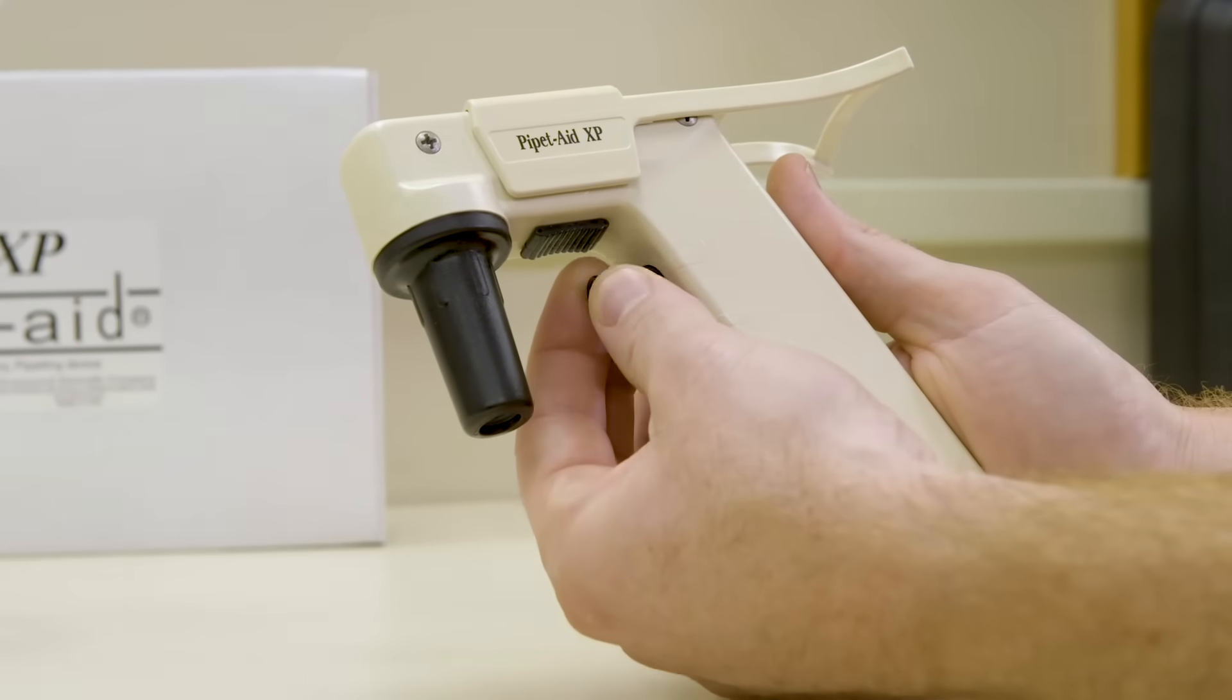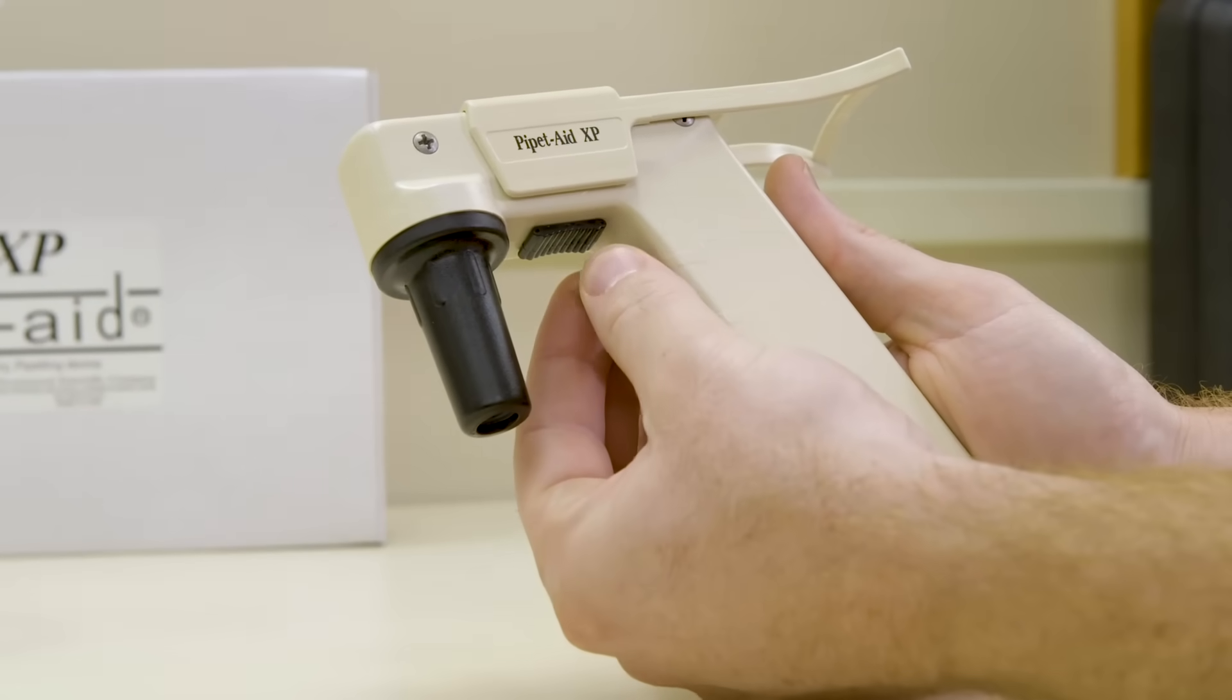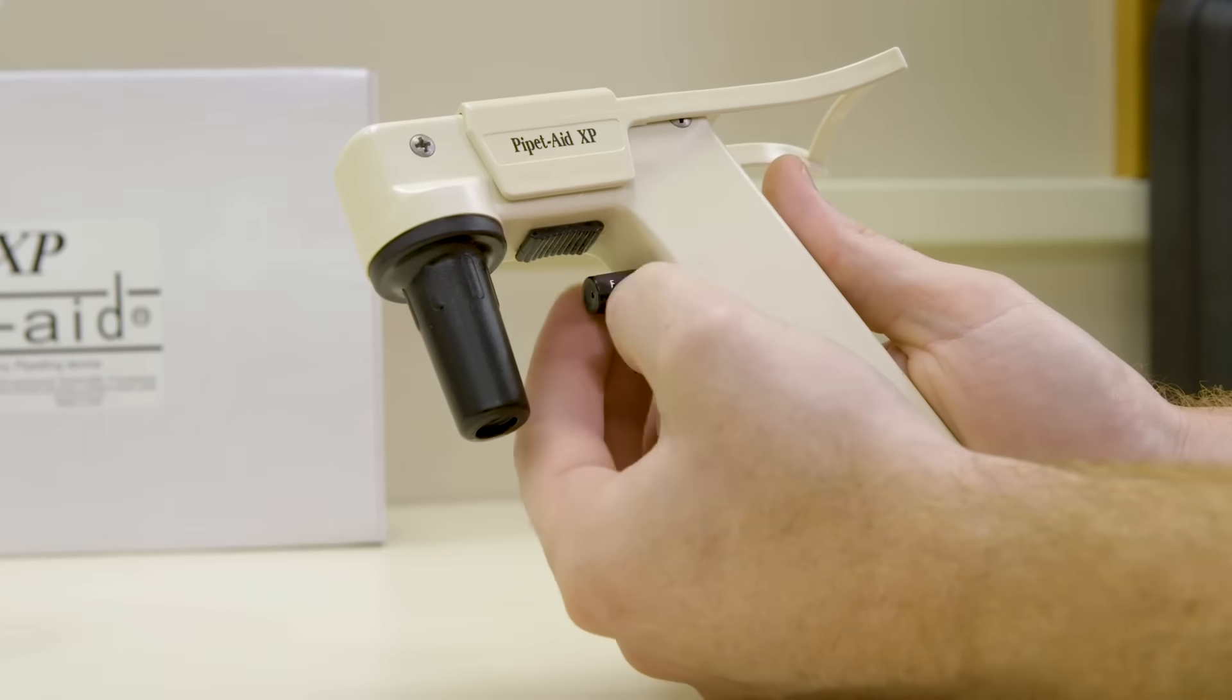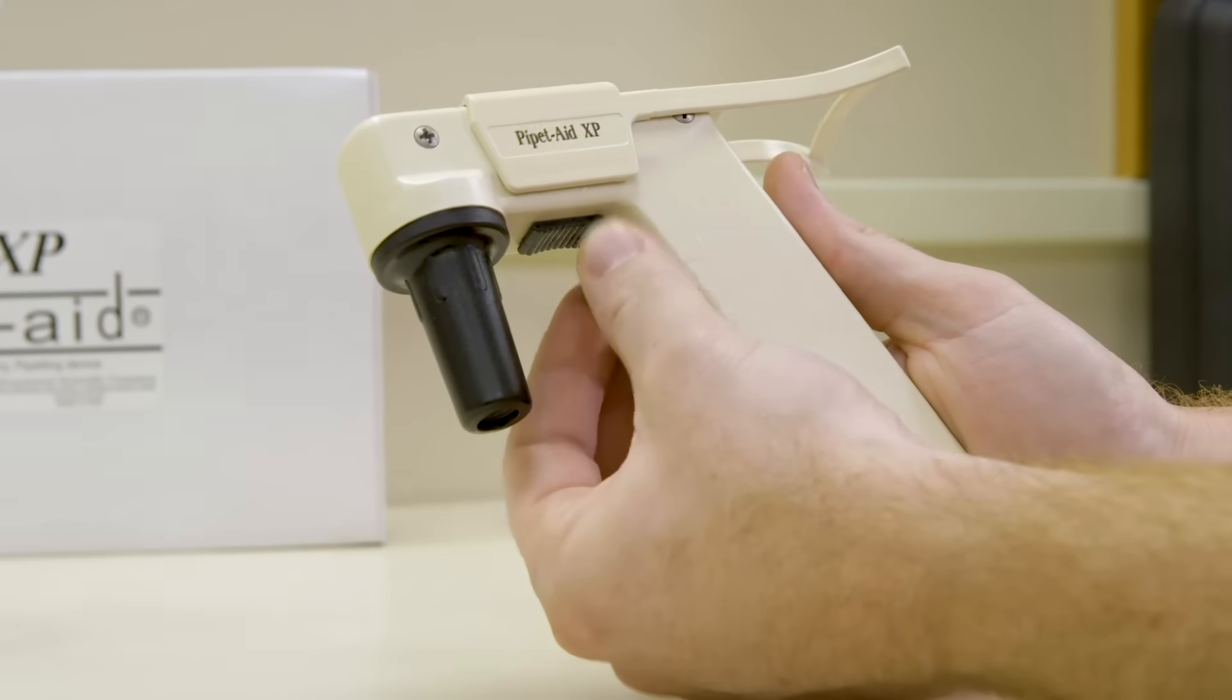If they spin freely, that would indicate the button is broken.